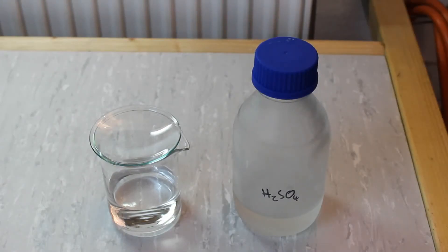Hello and welcome to Chemex. Today we will be synthesizing diethyl ether by acid catalyzed condensation of ethanol.